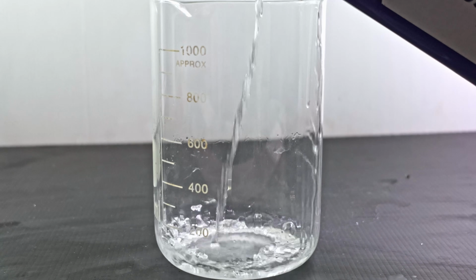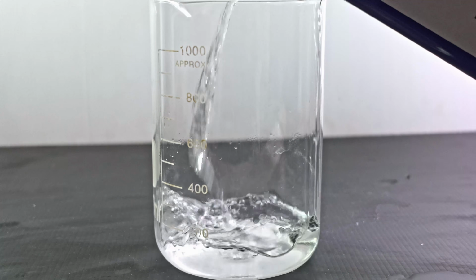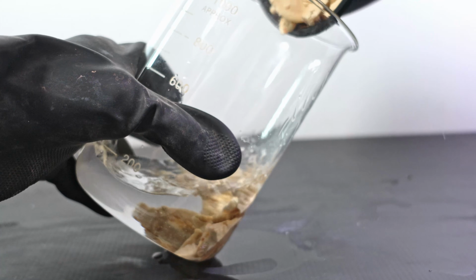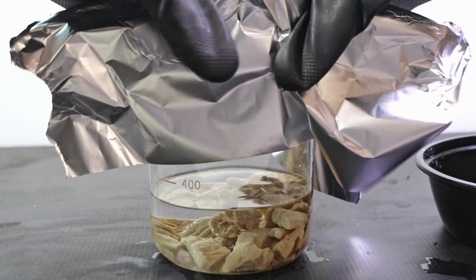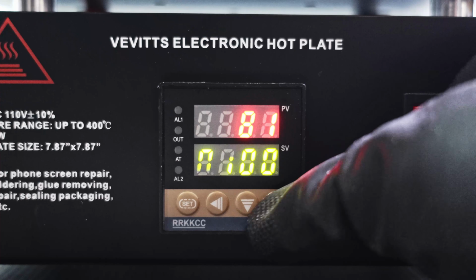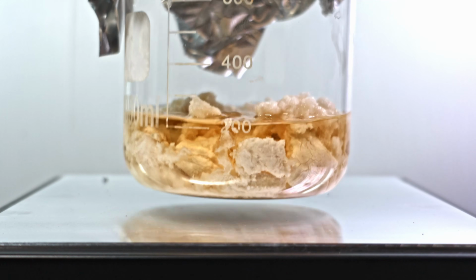To see if there's still something usable inside, I'm going to try to perform a Claisen condensation. To start, I fill up a beaker with ethyl acetate. I put in about 100 grams of my base. I seal it so moisture doesn't enter nor the ethyl acetate evaporates. I turn it up to 100 and let it cook. About a day later, nothing really happens.